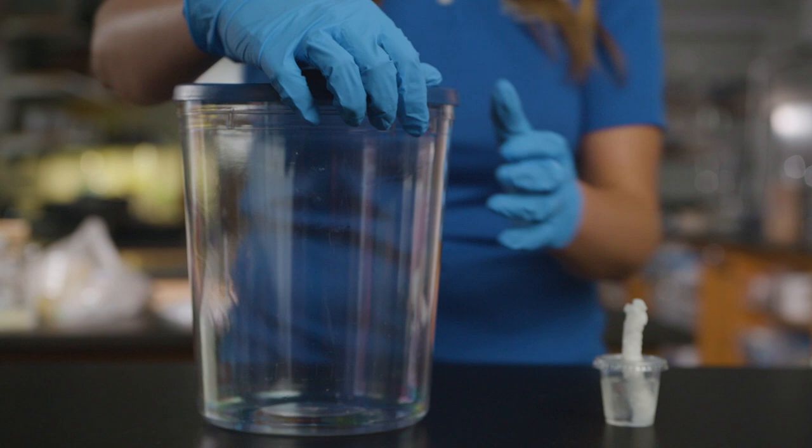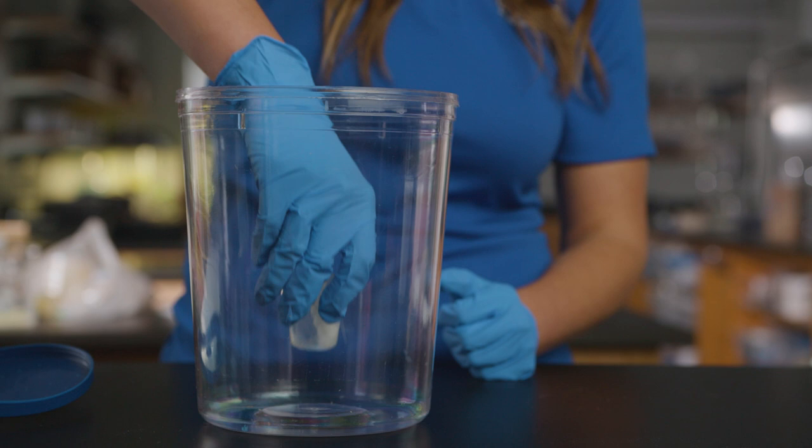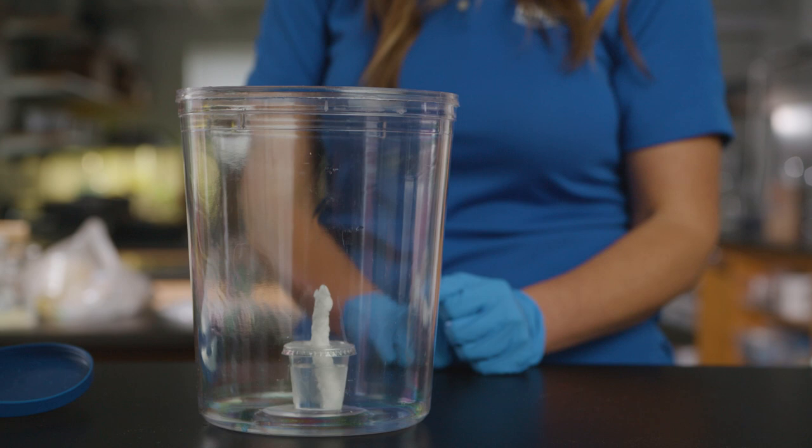Place the water container on the base of the culture container. Once your culture is growing, water should be changed if the level is low in the reservoir or if the water or wick becomes fouled, about once a week.